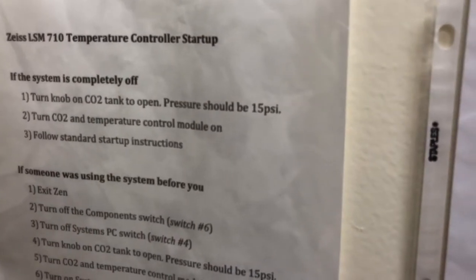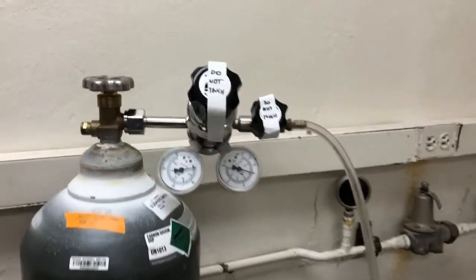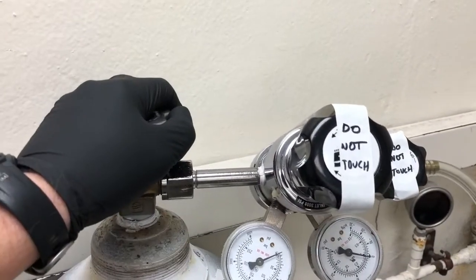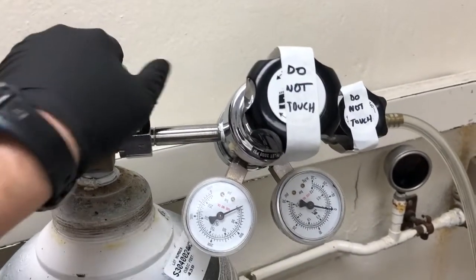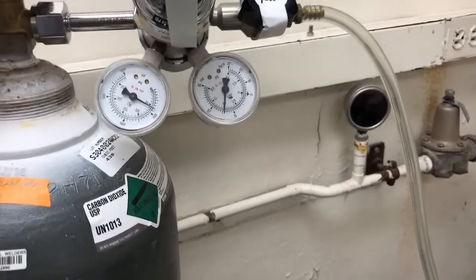So the first one is to turn the knob on the CO2 tank to open. The pressure should be 15 PSI. So that is over here. Don't touch the knobs that say don't touch. This is the valve to open it. So you open it by turning it counterclockwise.